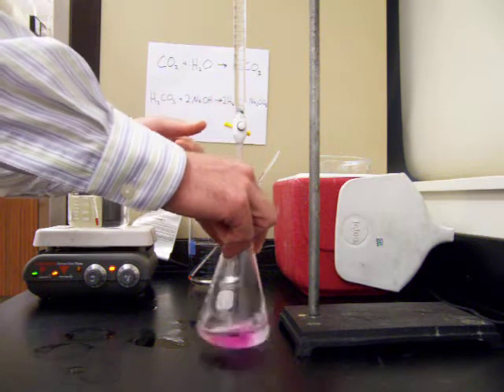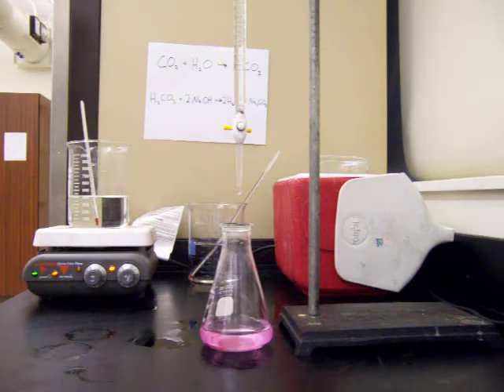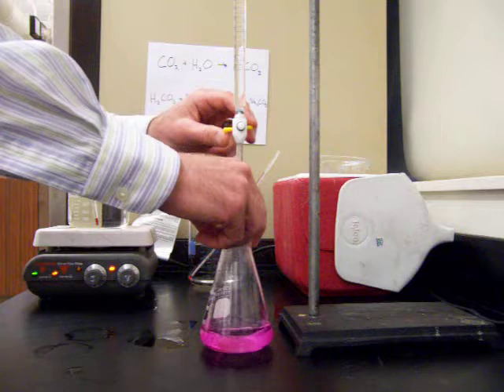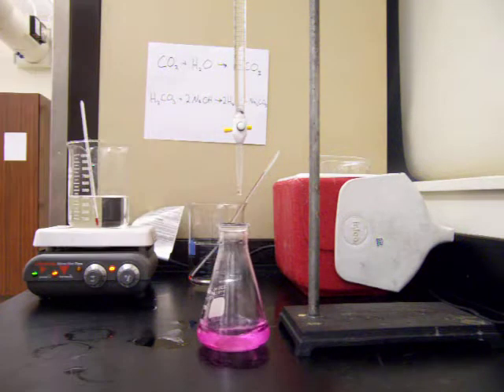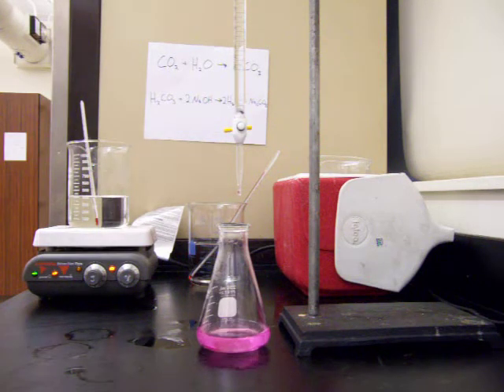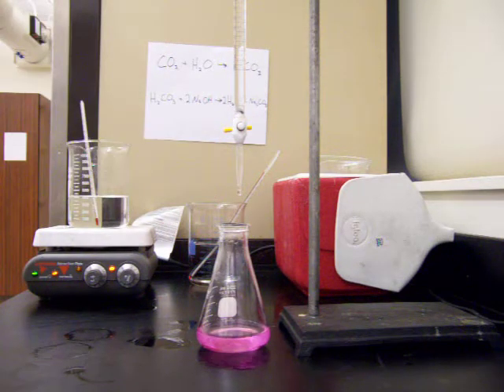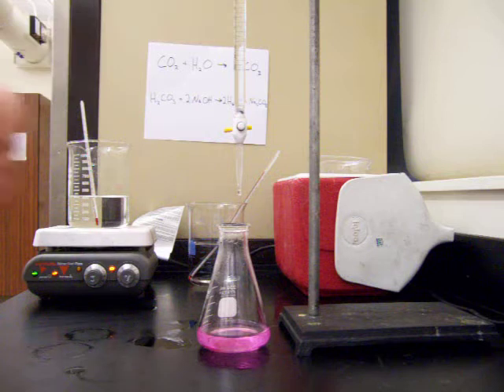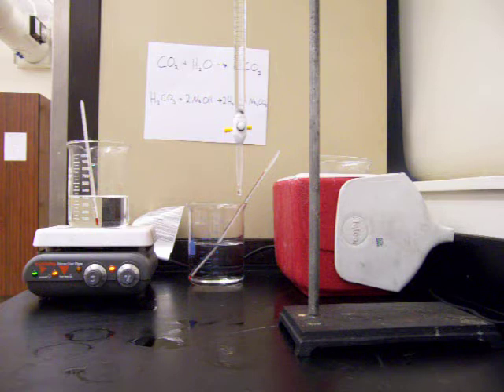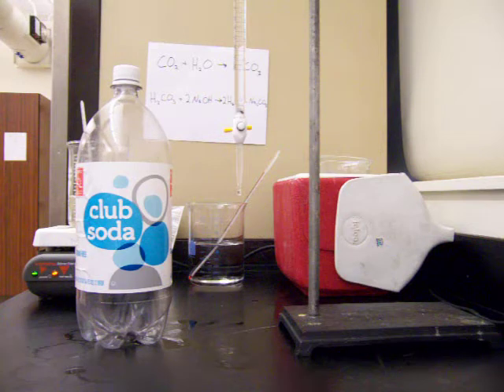This is our warmest solution and it appears as though it's going to reach the equivalence point the quickest. The one that reaches the equivalence point fastest had the lowest concentration of carbon dioxide initially. There — we have a pink solution, the equivalence point has been reached, and the sodium hydroxide has completely neutralized the carbonic acid. The final reading on our burette is 33.1 milliliters, so you take the difference between 28.3 and 33.1 to find the amount of sodium hydroxide needed.